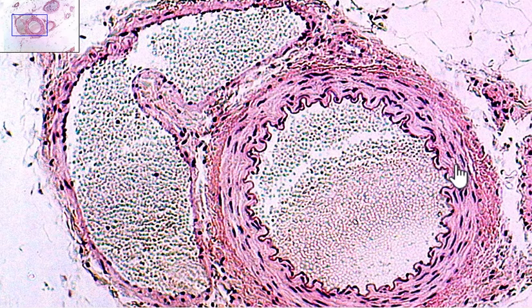The middle tunic, which is this part right here, this area is the tunica media. Now this tunica media is made up primarily of smooth muscle, so it allows for contraction of the vein or the artery. In this case, this is an artery. And this external tunic, the one on the outside, this is the tunica externa. Now the tunica externa is made of primarily connective tissue.